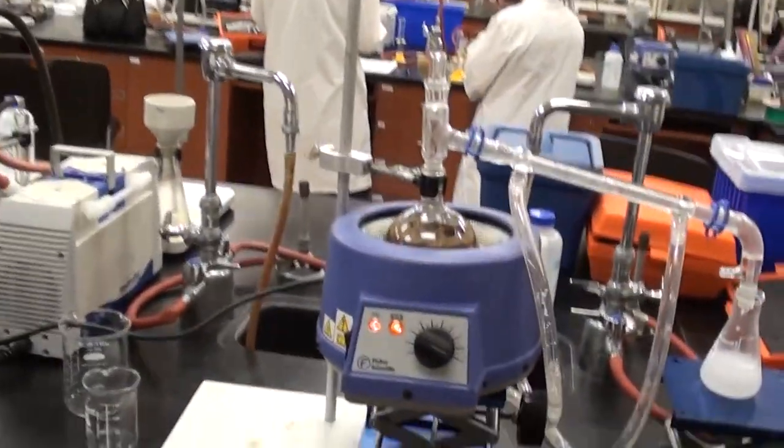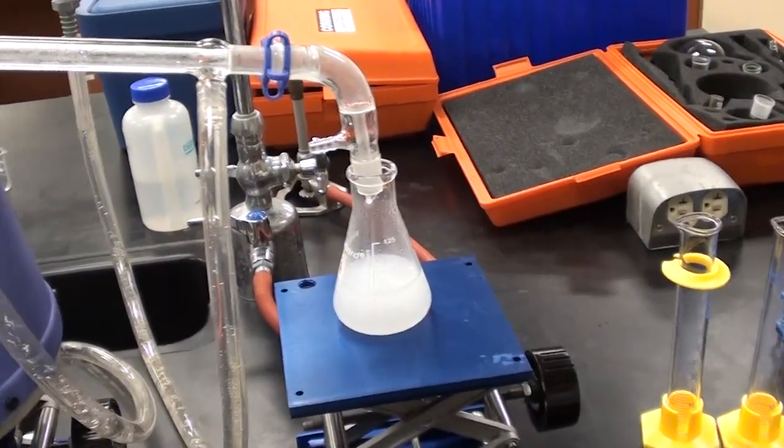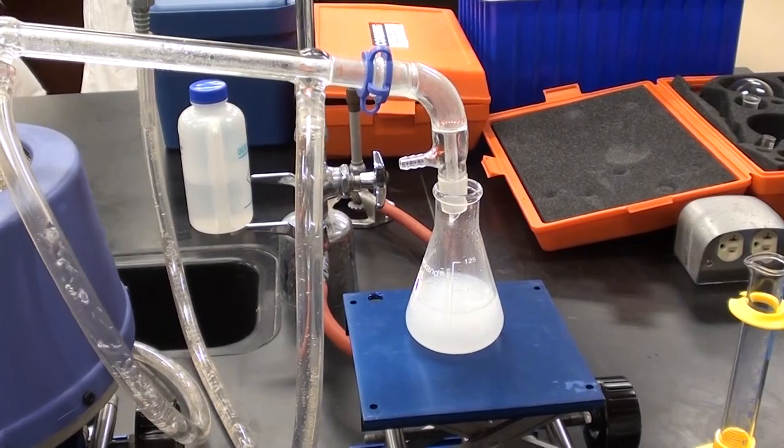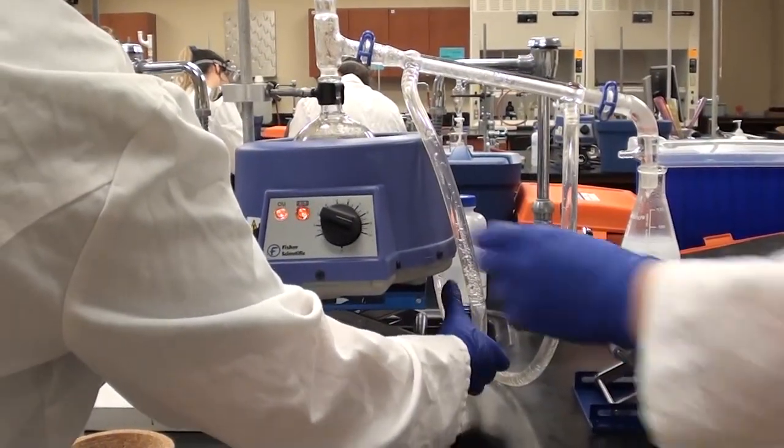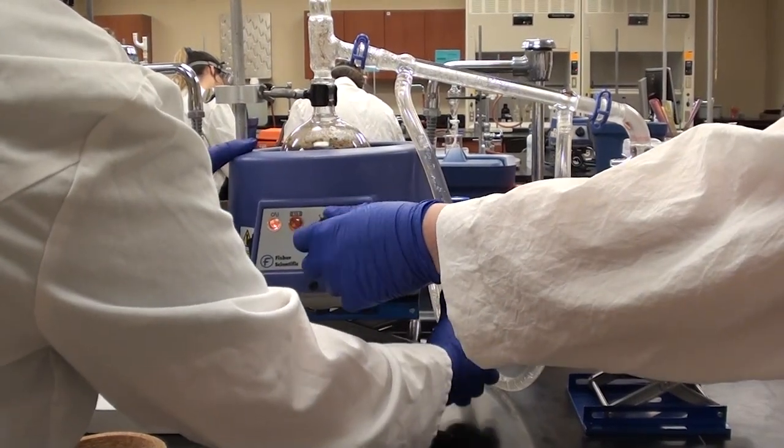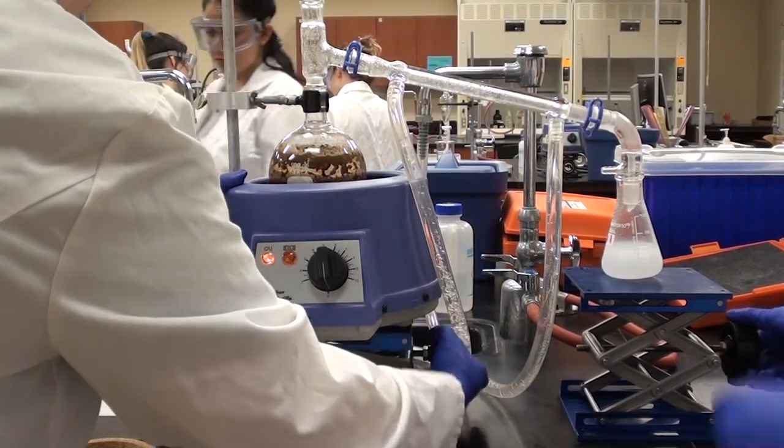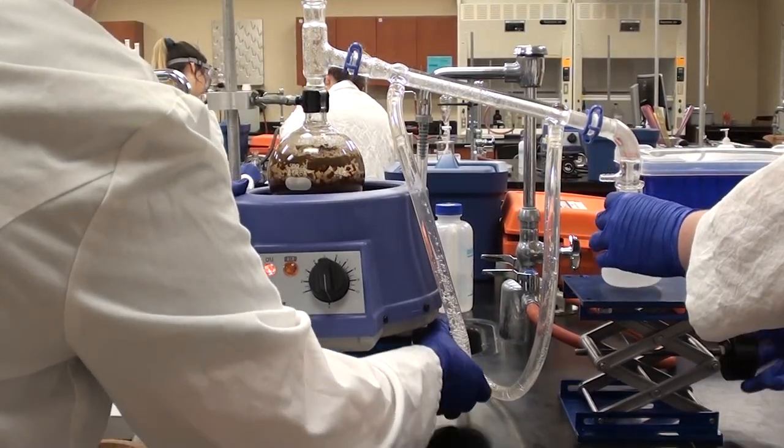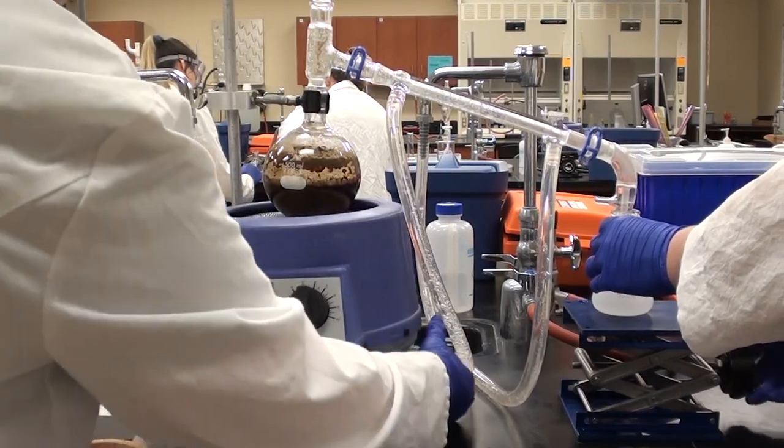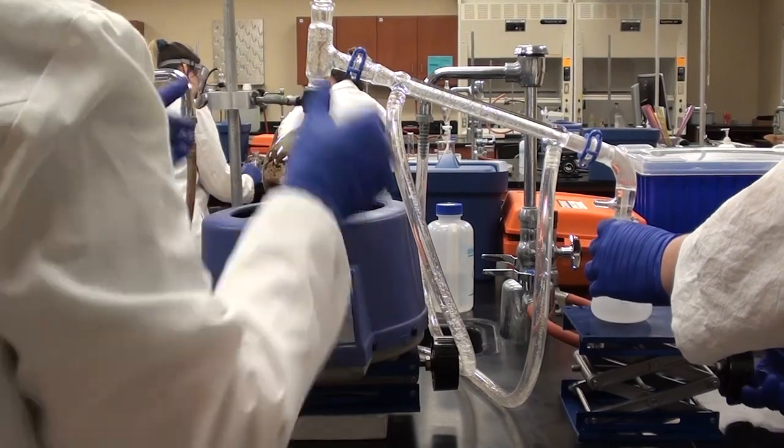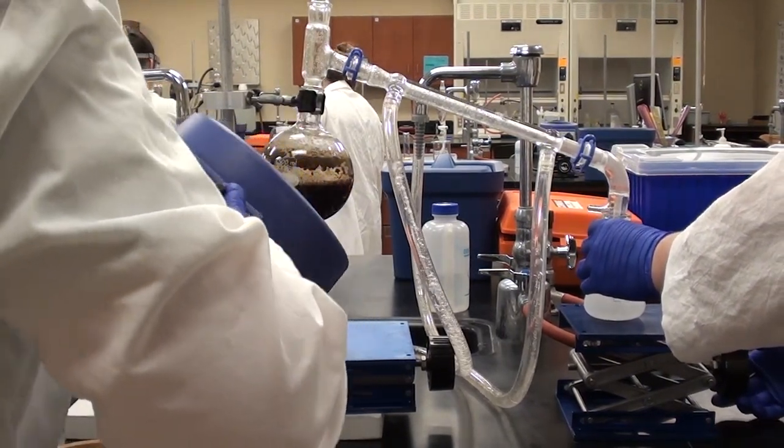You can see here that the thing is completely in the mantle, and the temperature's at 10, and now they've got a lot of material, probably more than what they need, which is good. So now we're going to go ahead and cool this thing down, so we're going to take everything apart. Let's turn everything off please. We're going to take the heat right away as well.